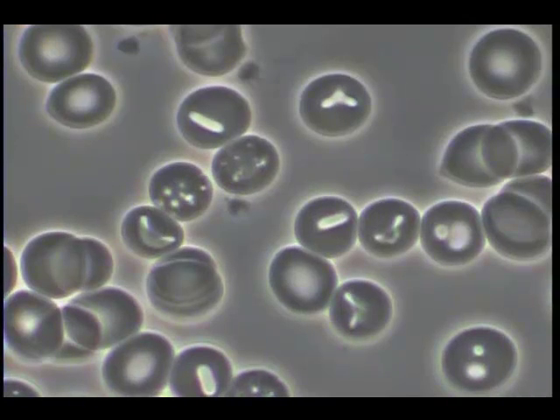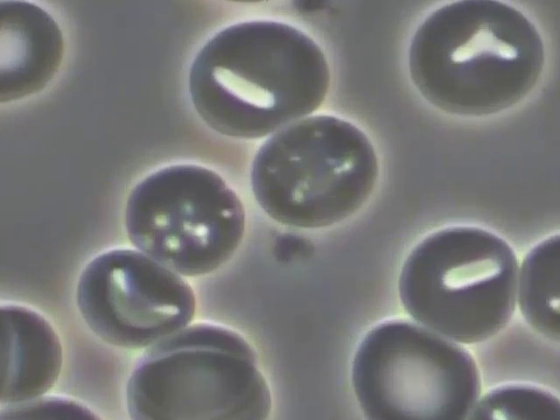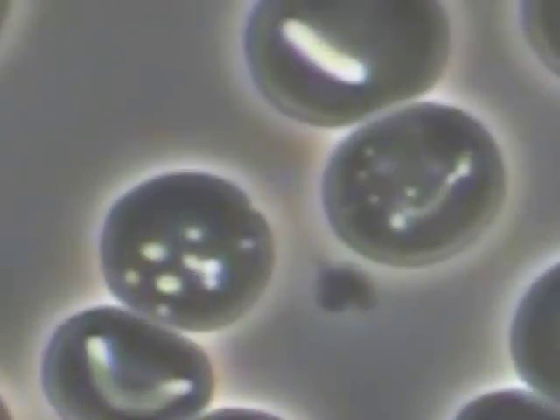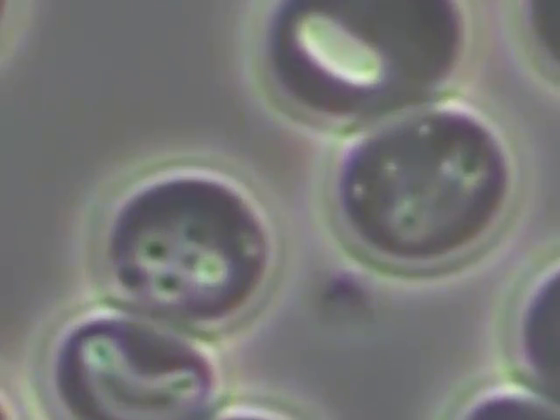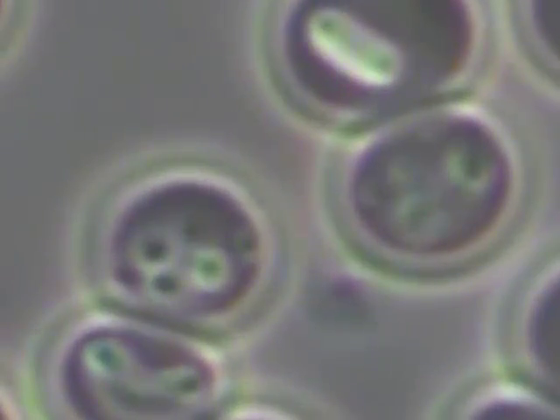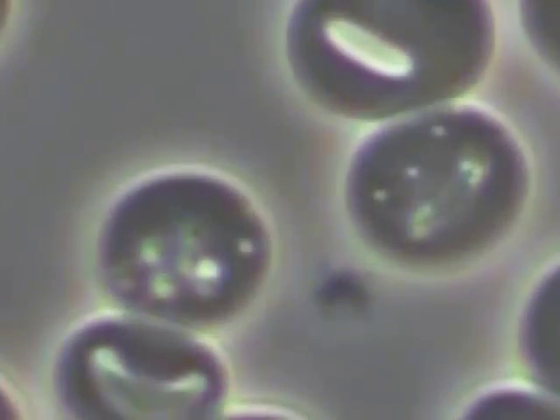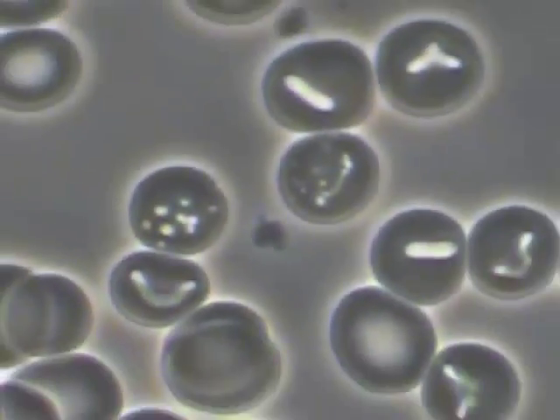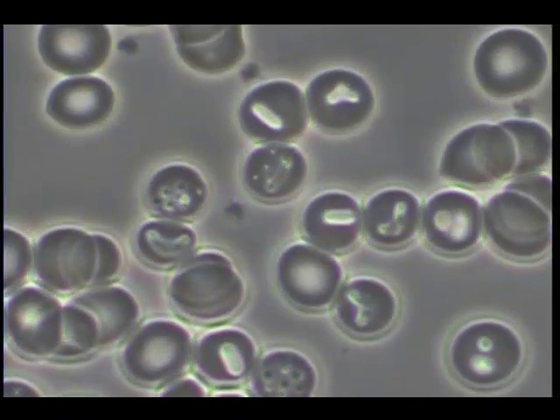This series illustrates the same items in motion. Notice the tendency for a significant number of disturbances on the erythrocytes.